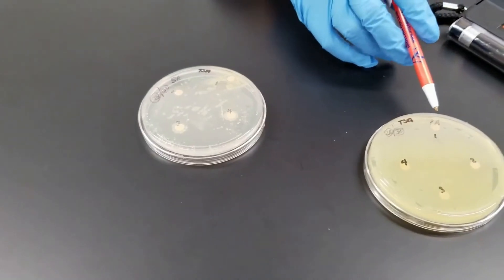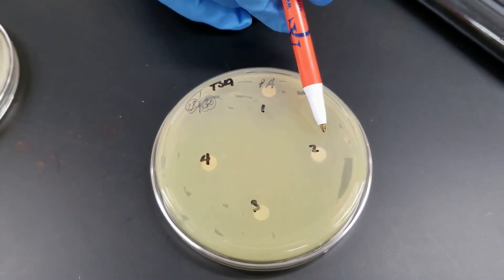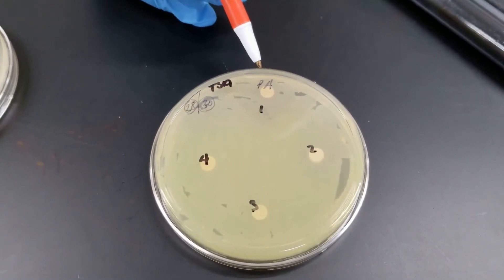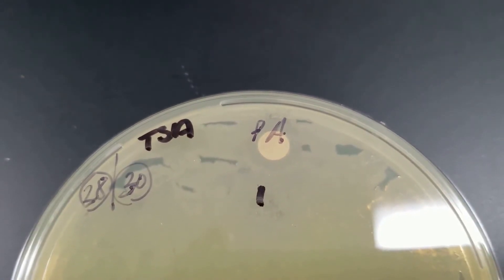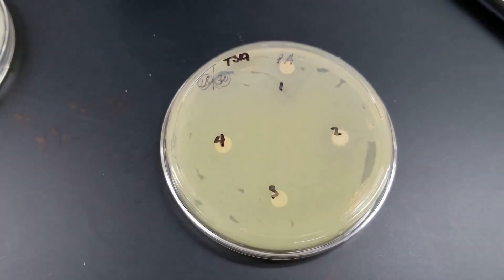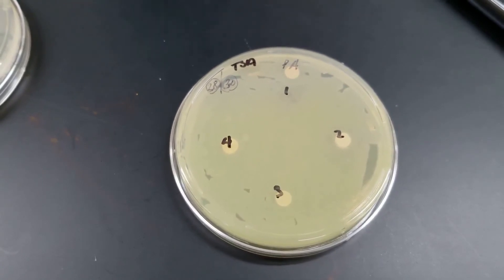Number one on this plate with Pseudomonas was iodine, followed by mouthwash, witch hazel, and then pine sol. There's a very faint decrease in growth around the iodine — it's kind of difficult to see. There was some growth but it's not quite as heavy. Pseudomonas aeruginosa — any of the Pseudomonas species — we are seeing more problems in healthcare settings where they can pretty much grow on anything and it's hard to control them, which is what we're seeing in this case.